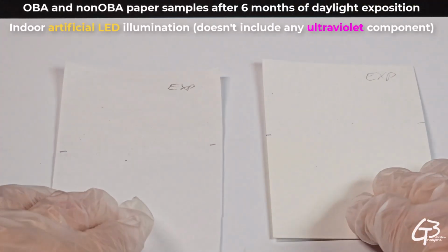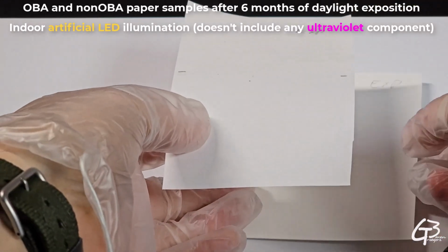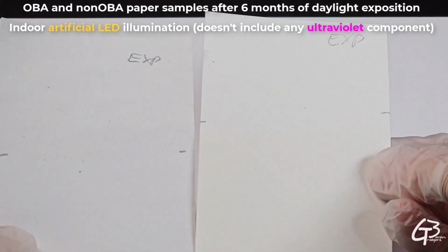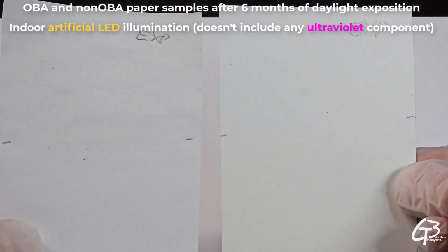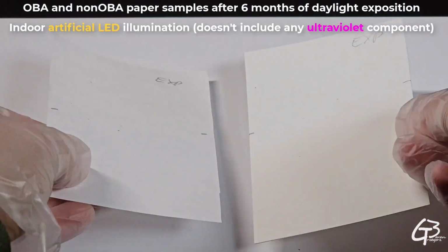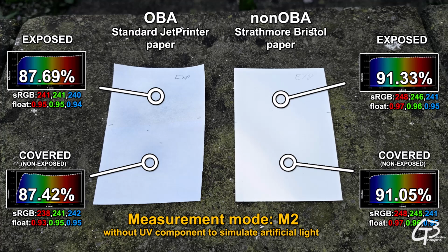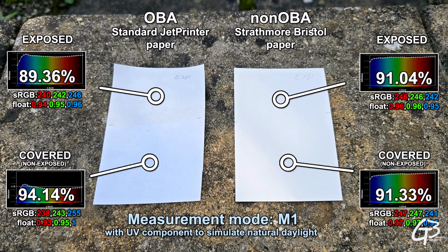Now let's take a look at values measured in M2 mode, without the ultraviolet component. Since this light doesn't include any ultraviolet component anymore, there is no radiation that can trigger the brightening agent to glow. Therefore, the OBA paper looks significantly darker and that's it. The non-OBA one, since it doesn't rely on a brightening agent, doesn't look affected by this change and still looks the same bright, with not much difference.